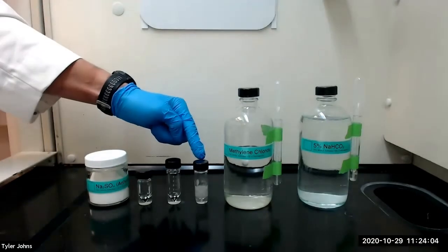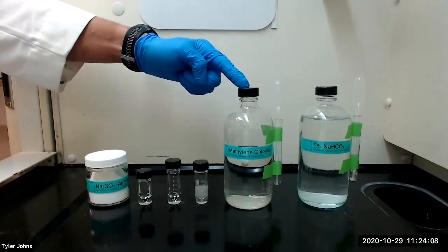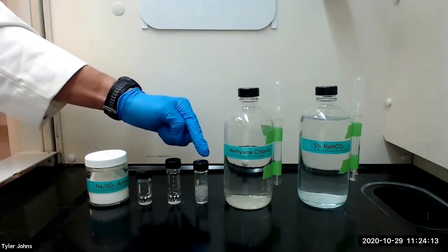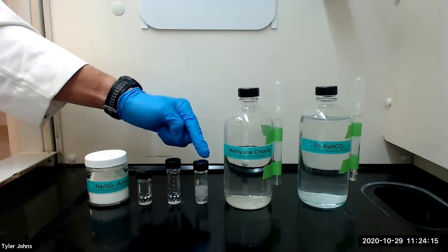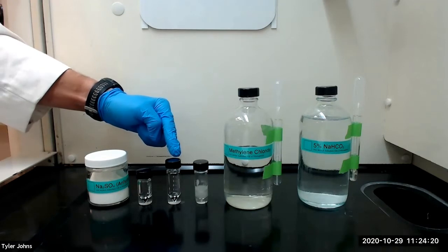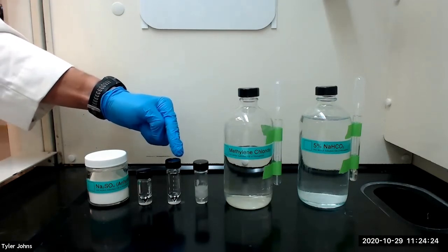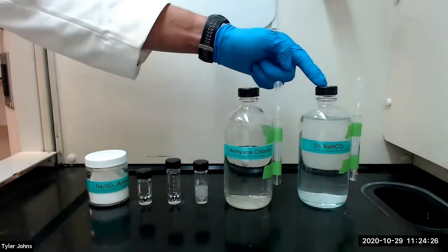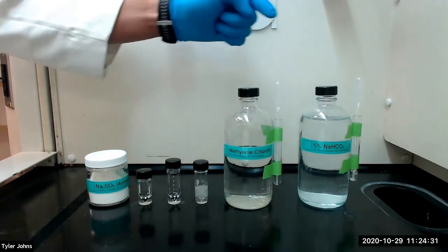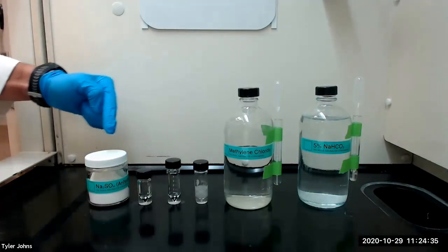After the mixture has cooled, we will extract it with 3 one-milliliter portions of methylene chloride. Each time we add the methylene chloride, we will cap the vial and shake with venting. We will then allow the layers to separate and transfer the bottom methylene chloride layer to a new 5 milliliter conical vial. After completing the 3 extractions, we will extract the methylene chloride layer with a 1 milliliter portion of 5% aqueous sodium bicarbonate. We will then transfer the lower organic layer to a new 3 milliliter conical vial and dry over anhydrous sodium sulfate.